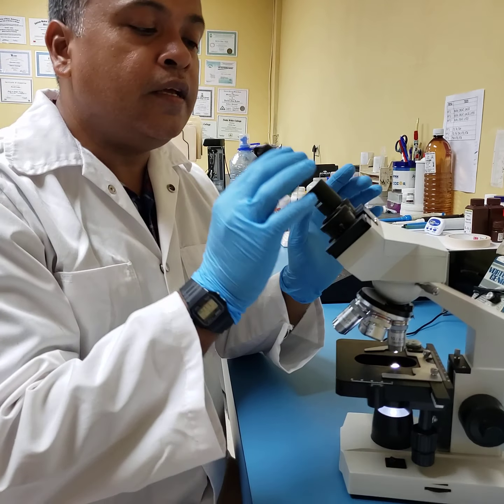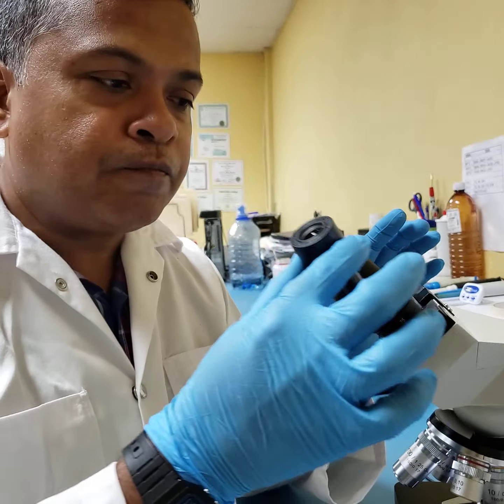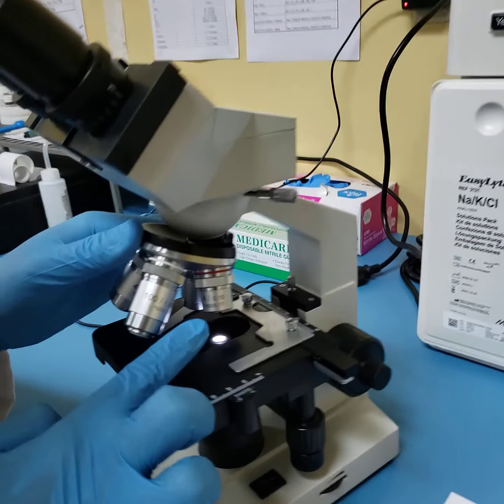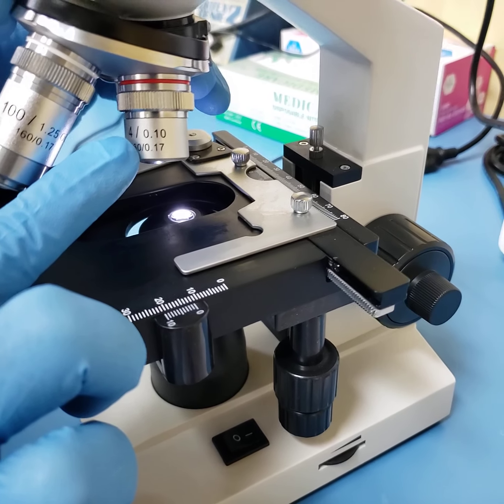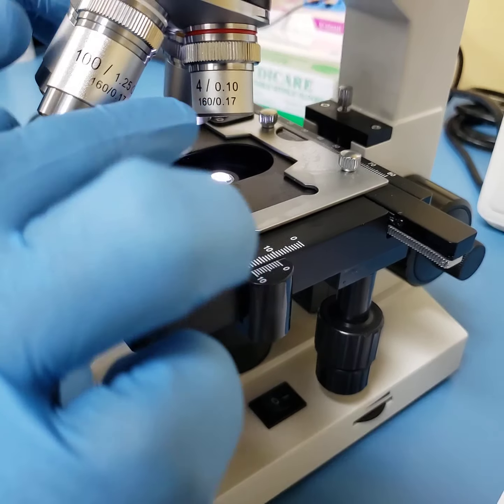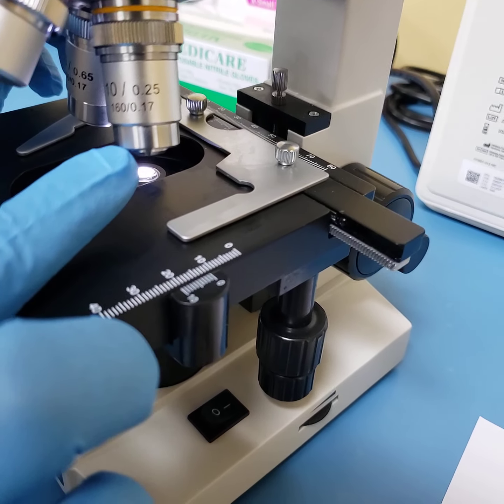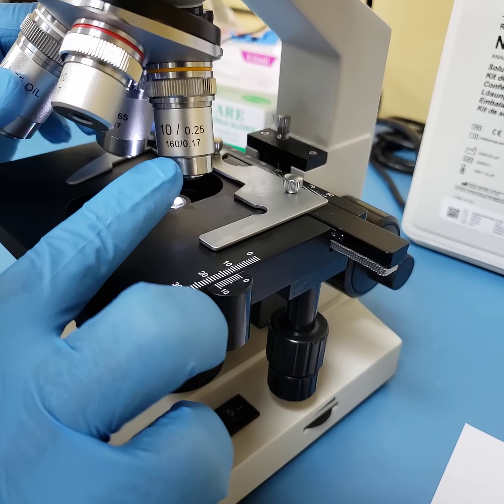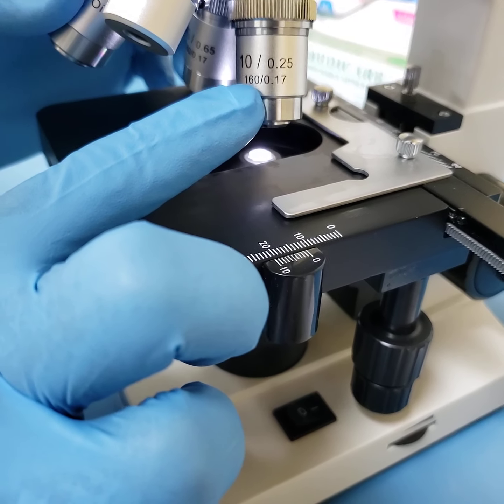We just mentioned that the magnification of the eyepiece is 10, but moving further now, when we talk about lenses, and I'm just going to turn it so that you can see, your shortest and lowest power lens is your ×4. Your ×4 is also called your scanning lens. As you go from ×4 and you notice the lens has automatically gotten longer, you have a ×10. Your ×10 is called your low power objective.